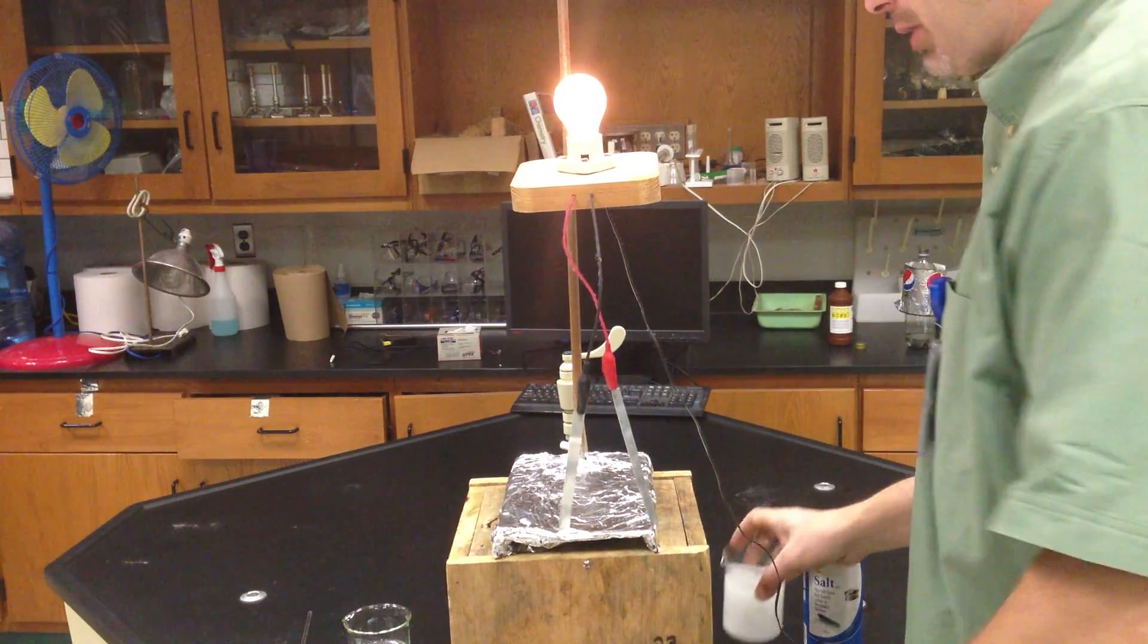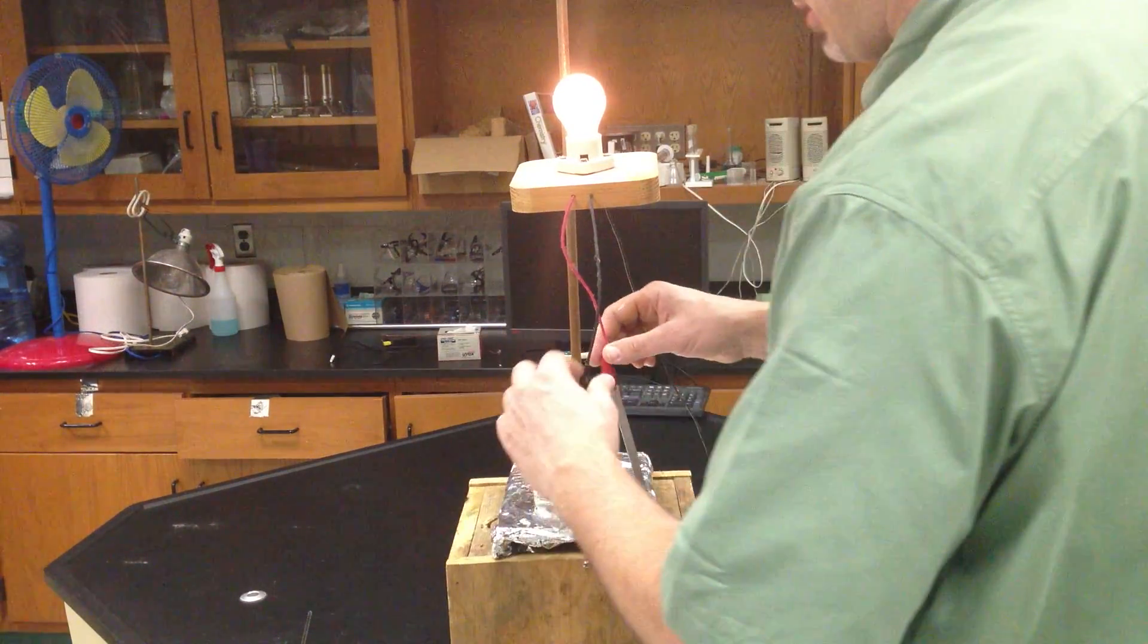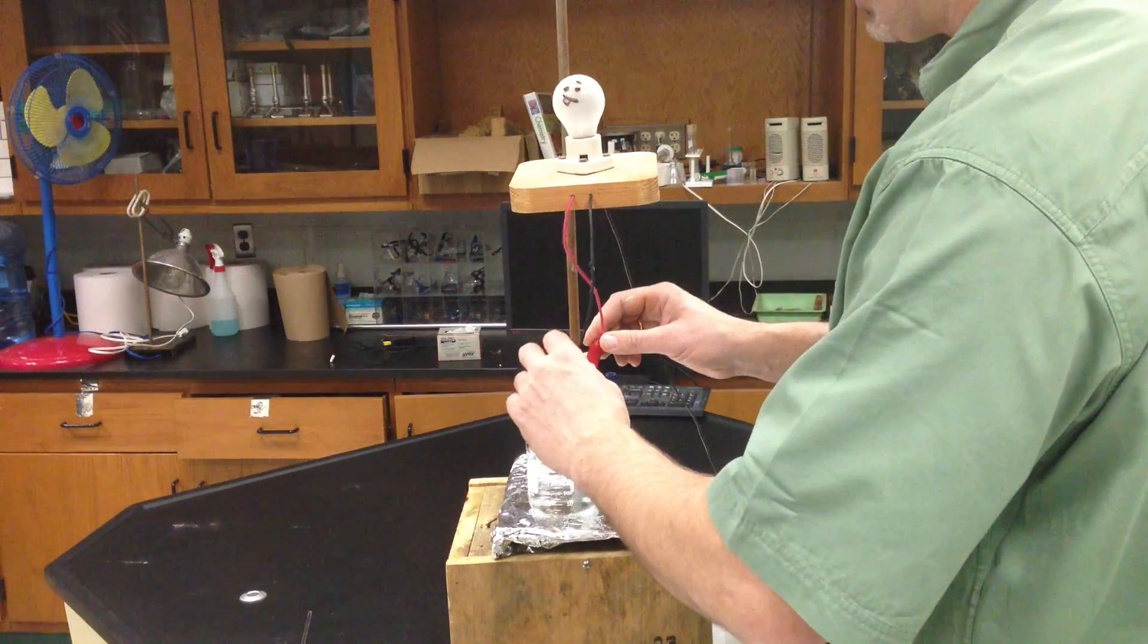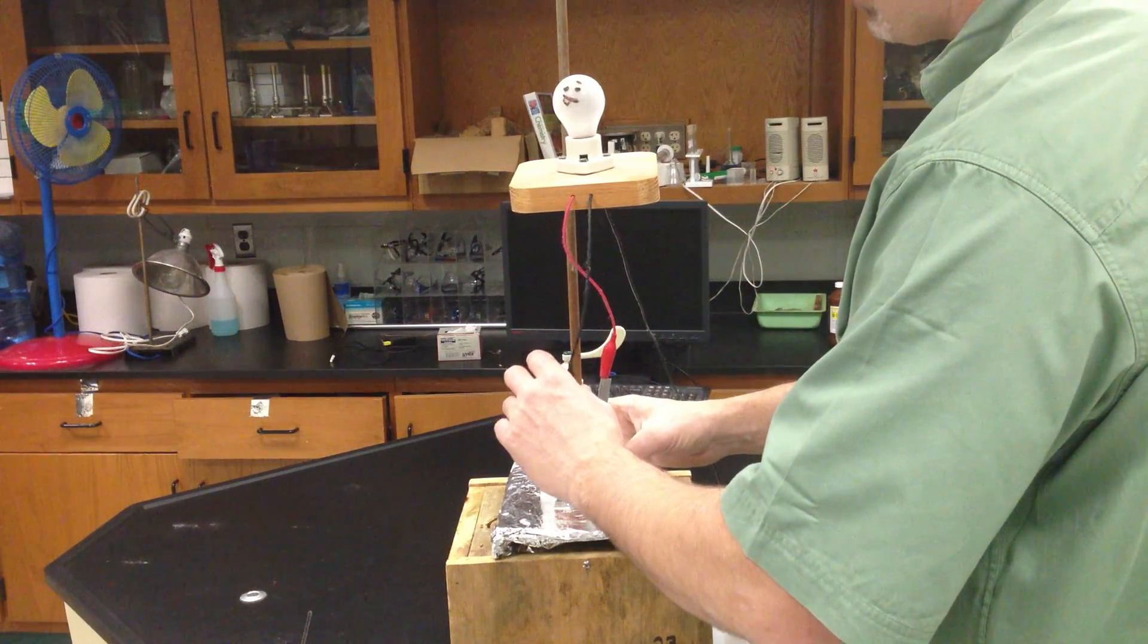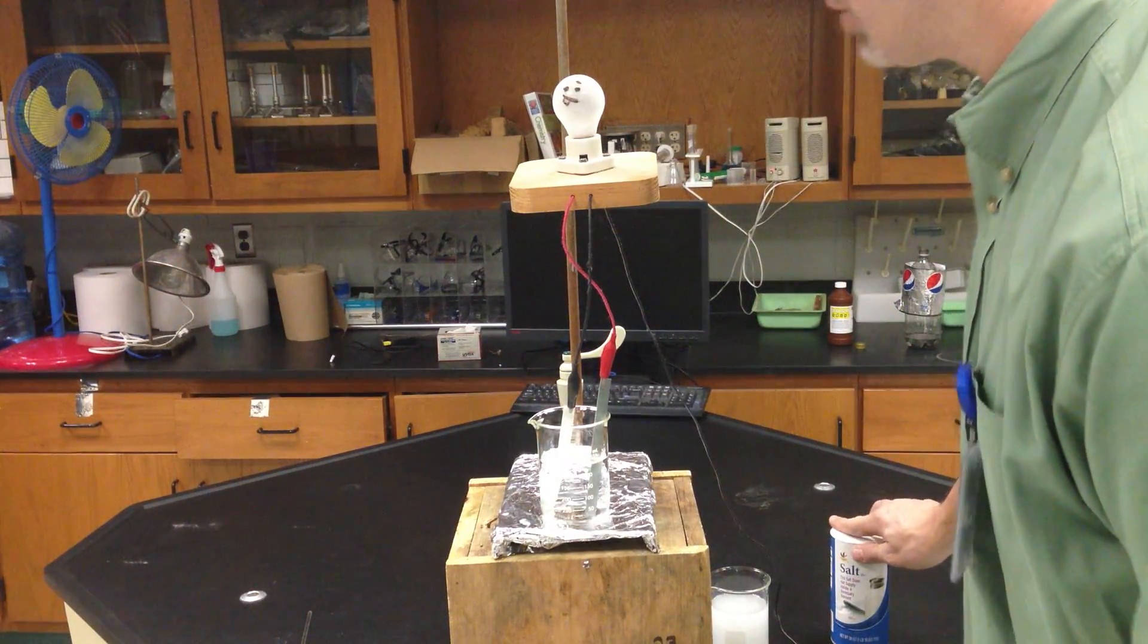Now, back to... Again, they're touching the metal, so they're going. Now I'm going back into water. Although I have some ions on here, it still should be not enough. So I have my ions here and my free water. And now I'm going to add sugar.